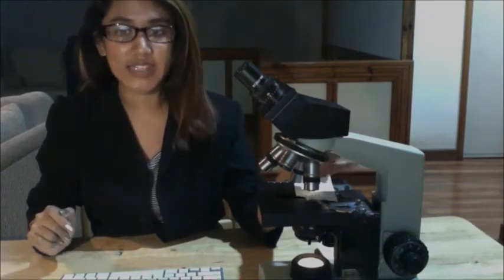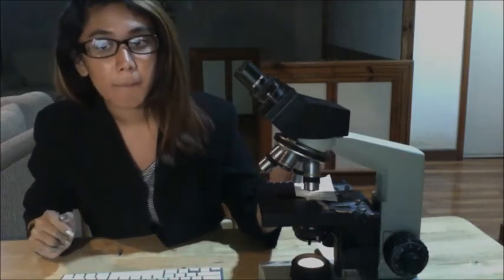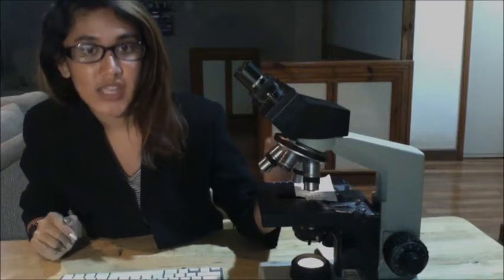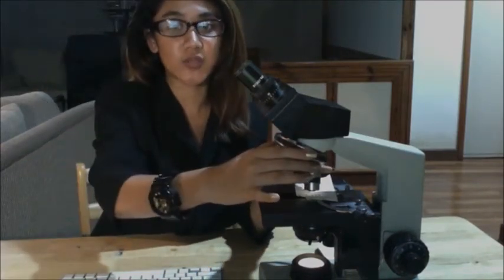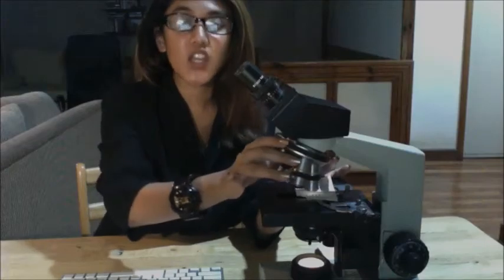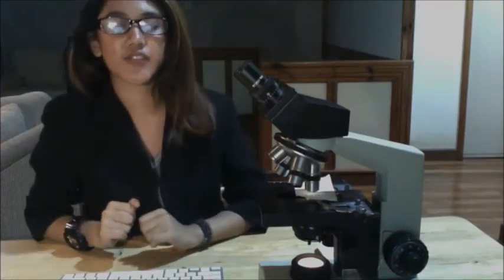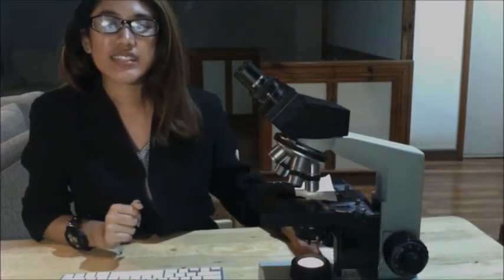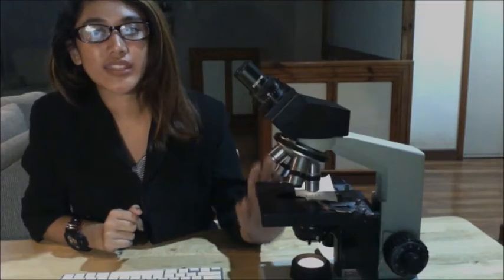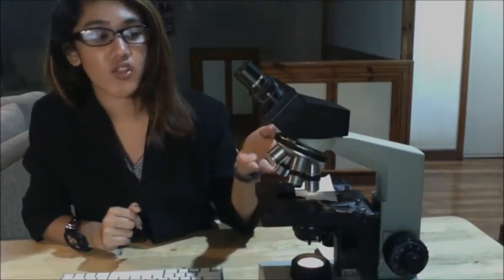Then place a drop of immersion oil on the slide at about the center point over the stage, and then carefully rotate the 100x oil objective into place with a click. From the side, you should notice a flash as this lens enters the oil. So you can see the actual connection between the lens and the oil on the slide.